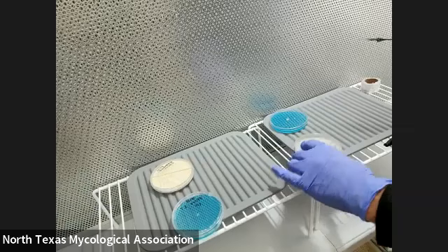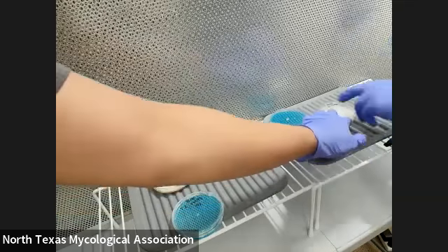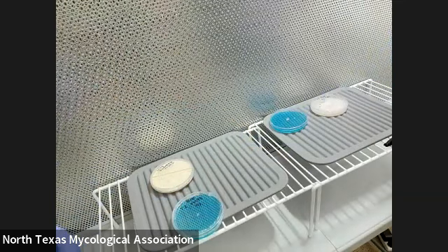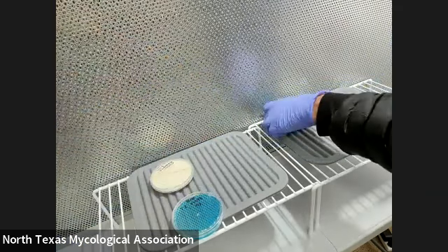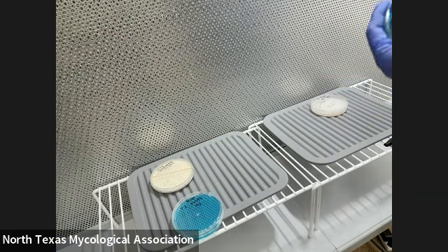What type of agar are you using? I'm using malt extract yeast agar. You can wrap it so you can get some practice — wrap the new plate first because that's what we worry about more than the other plate.